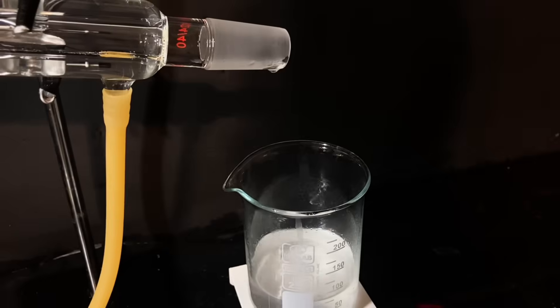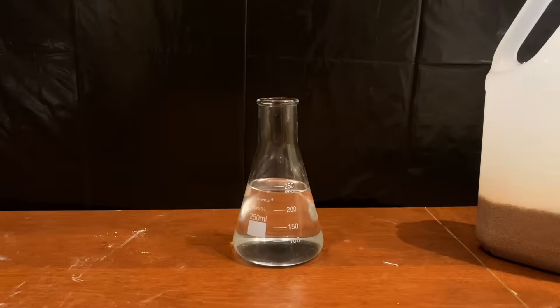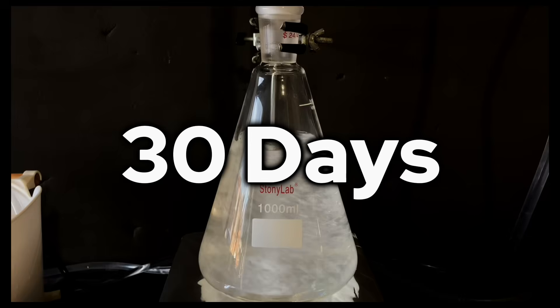This was the single longest experiment I had ever filmed, spanning a total of 30 days to get it all together, and over 100 hours of extraction and purification.